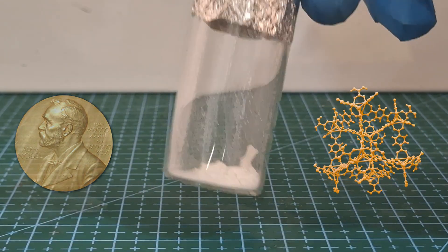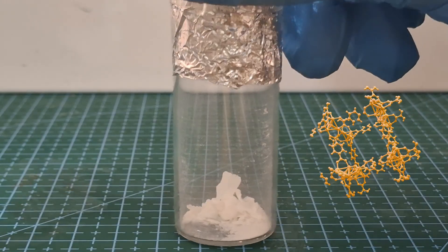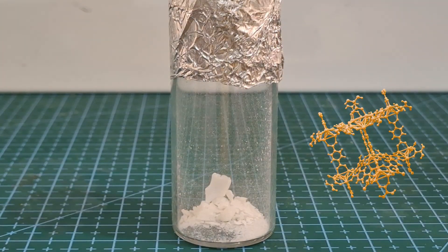So I'll show the synthesis of MOF-5, one of the first MOFs Omar Yaghi, the Nobel recipient, had discovered.